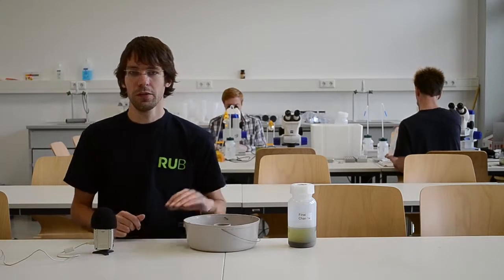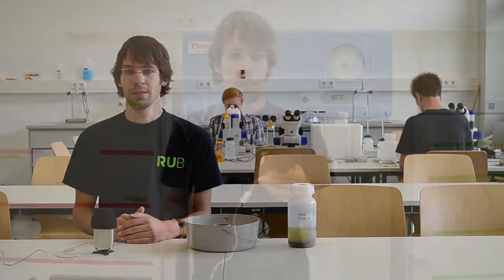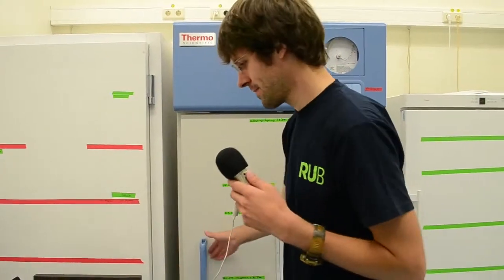We are back in Bochum with our samples, and together with 3 bachelor students, it's now time to carefully analyze our samples in a very standardized way. In the next few minutes, I will show you how we analyzed our samples. We have stored our samples at -20 degrees, and all of them are in ethanol for later molecular analysis. Let's take a look at one of those samples.